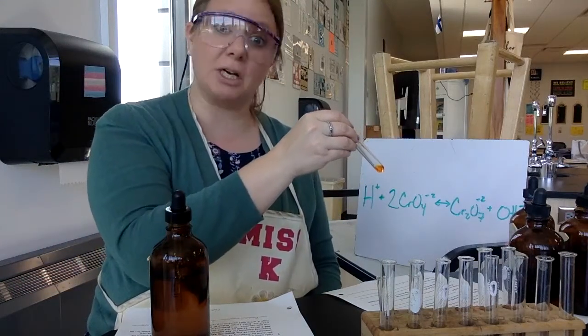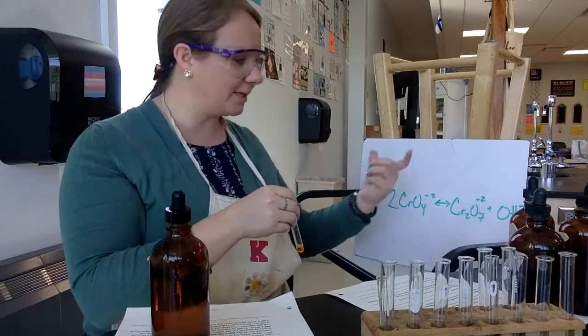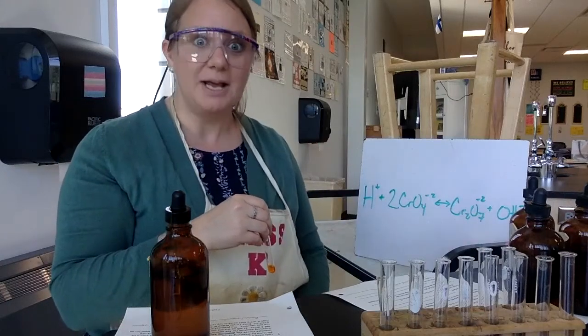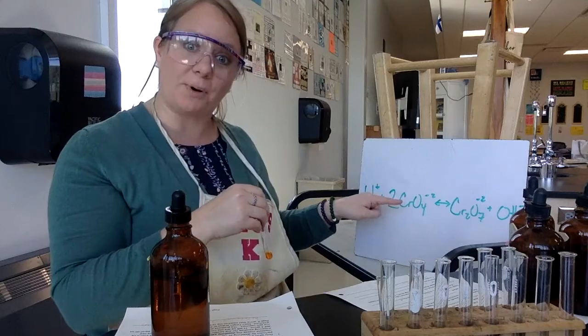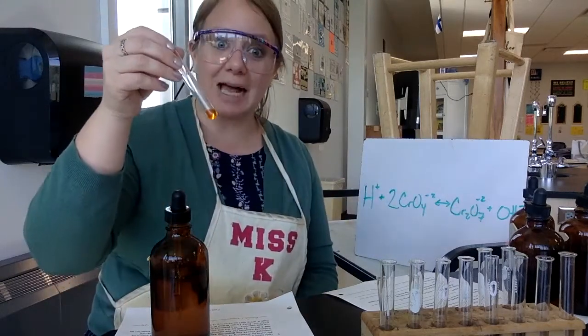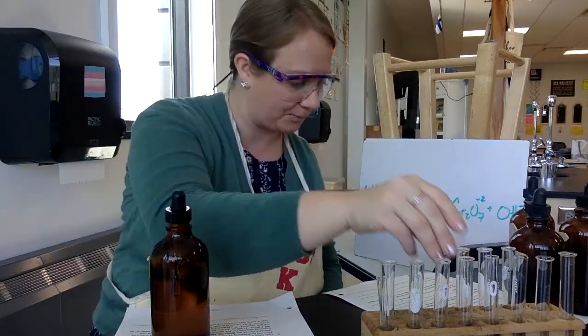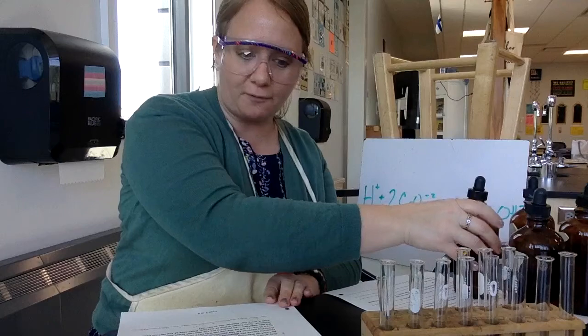Not really any change in color, because think about it. You added a reactant. If it adds a reactant, it's going to shift to the product side, right? So because these are always present, if these things react, they go to that side, right? So that's an idea, same thing, right? Added reactant, shifted to product. All right, we're on step 5. Go ahead and flip the page.